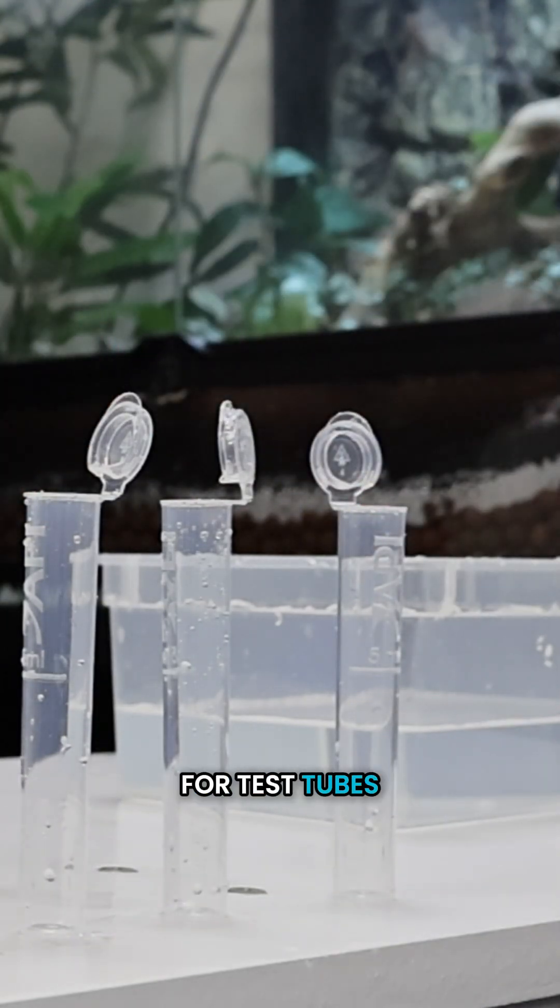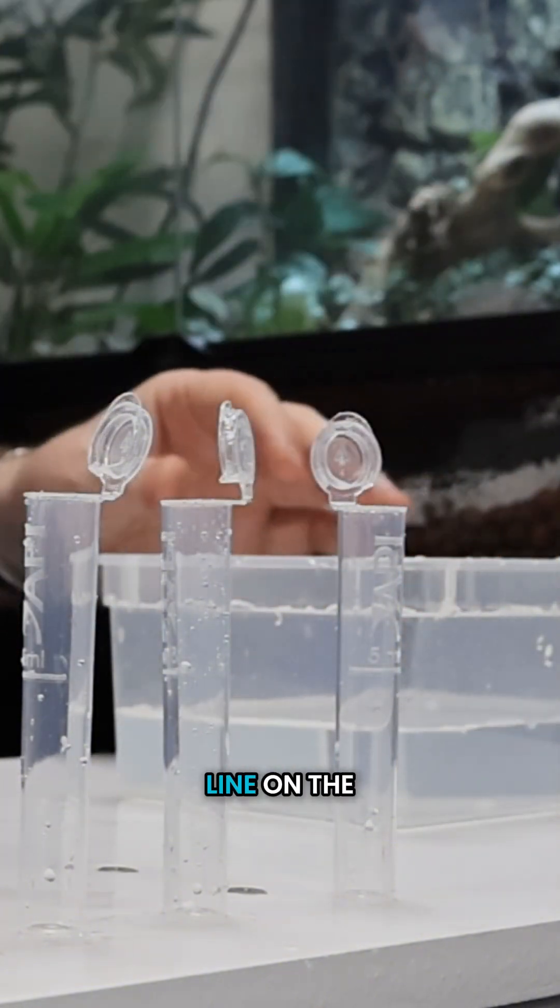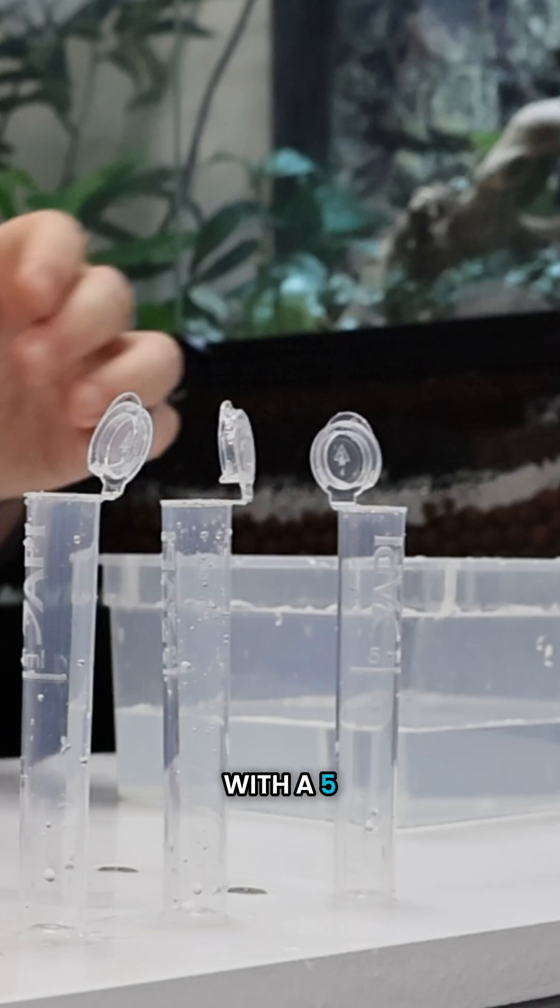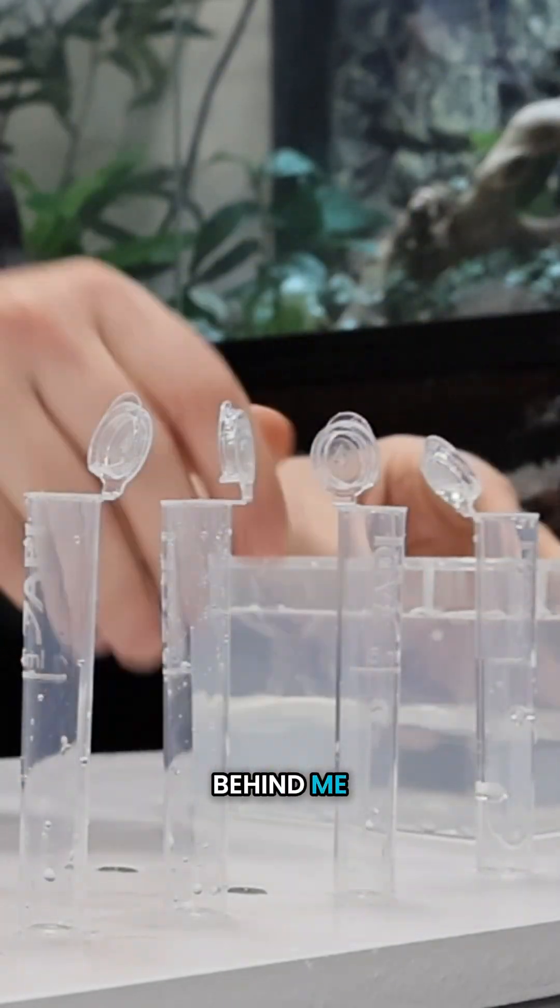Four test tubes or vials. We fill them up to the line on the vial with five milliliters of water that I've got from that aquarium behind me.